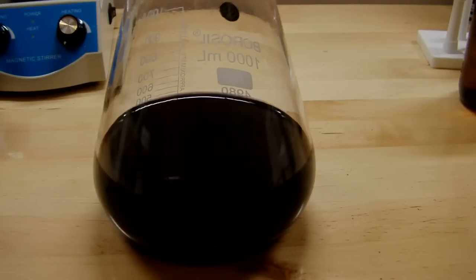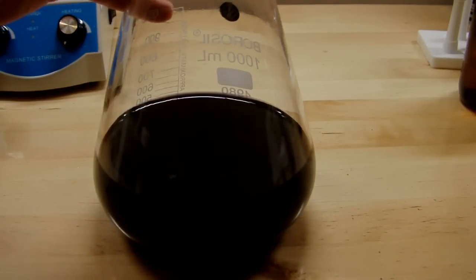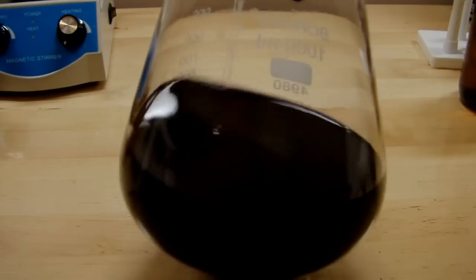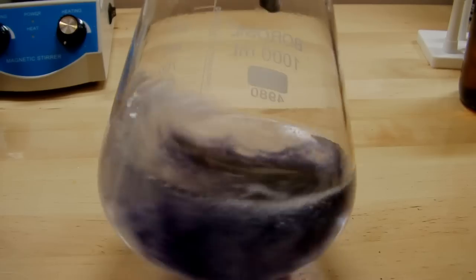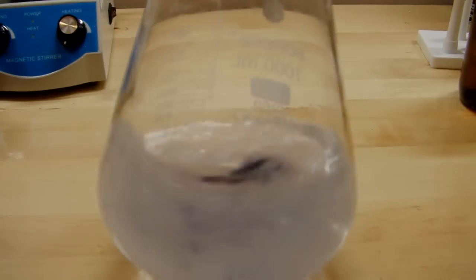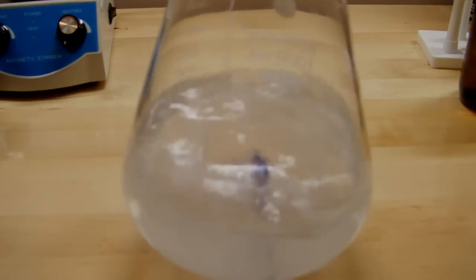I've been adding thiosulfate over the course of about a half hour and now we're finally starting to get close to the end. As you can see, when I swirl it to mix everything around and further dissolve the solid pieces at the bottom, we're starting to see it clear up a bit, which is what we want.